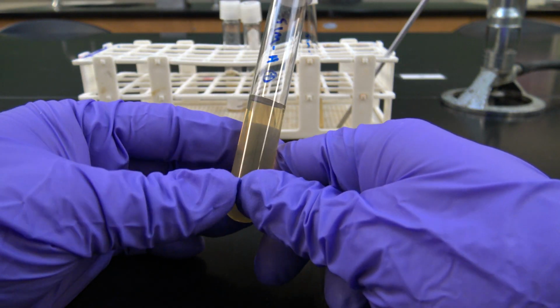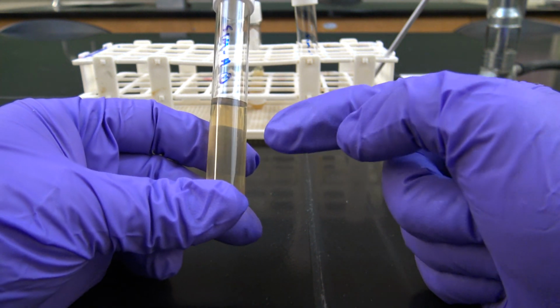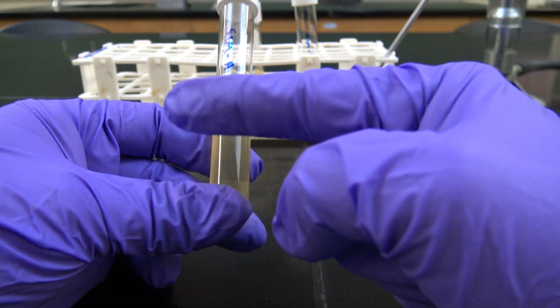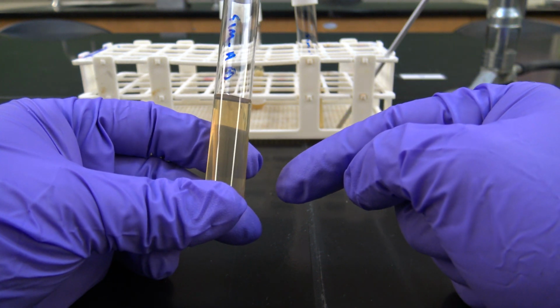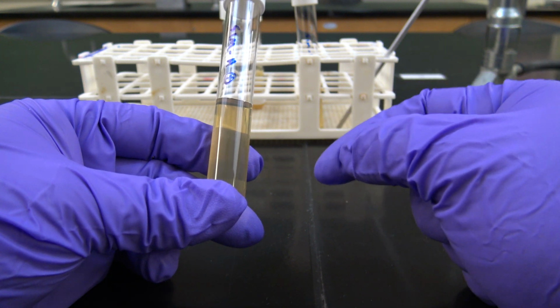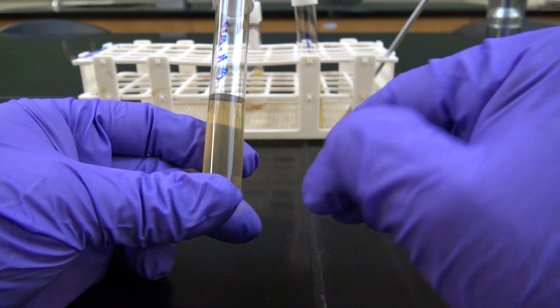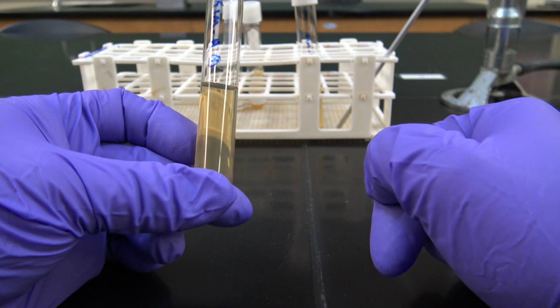And the semi-solidness of this media is going to help us determine if our microbe is motile, or is it able to swim or swarm throughout the media. And that kind of tells us what kind of external features the cells themselves have, as far as flagella and things of that nature, to help it move around in whatever environments it's in.